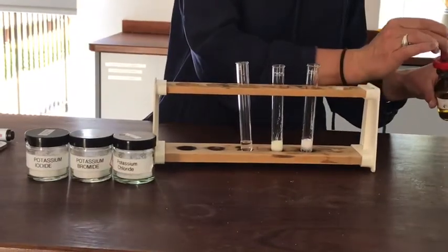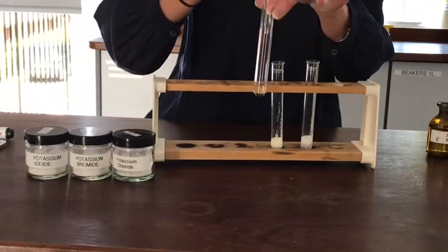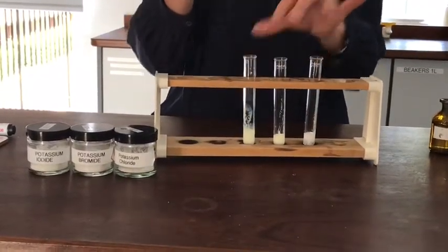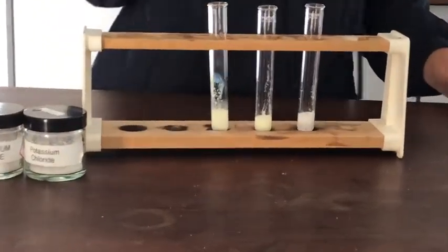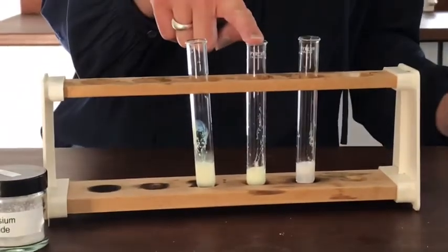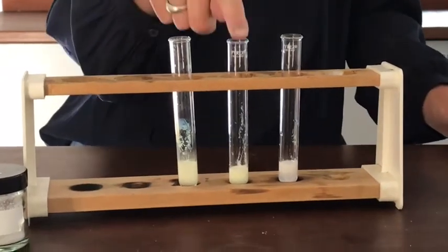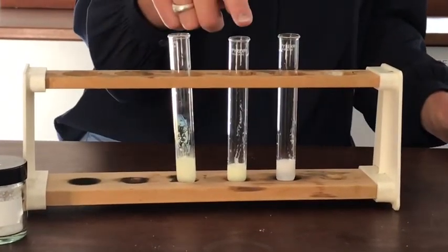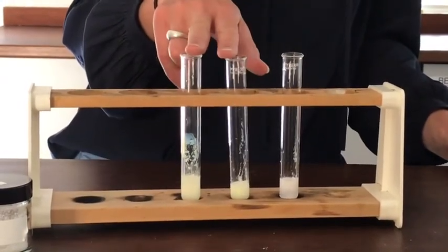Now, I don't know about the colour resolution on the film here, whether you're going to be able to see much difference between them. And again, in real life, it's not brilliant, the colour difference. We sometimes refer to them as milk, cream, butter to help us remember the different colours. This should be white, this should be cream, and this one should be yellow. Now, the reality is that this middle one is very tricky. Sometimes it looks very pale and looks like this. Sometimes it looks quite dark and looks more like this. And in fact, today, it looks more like the iodide tube.